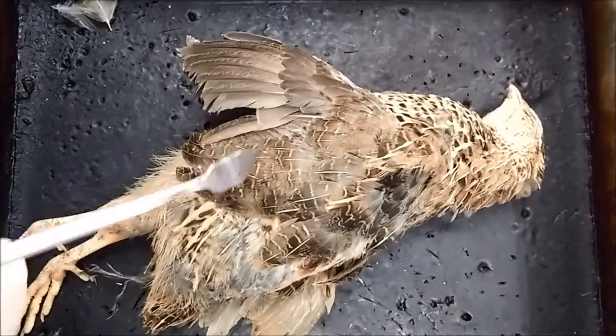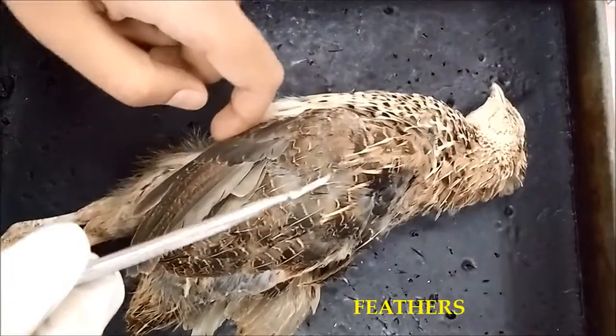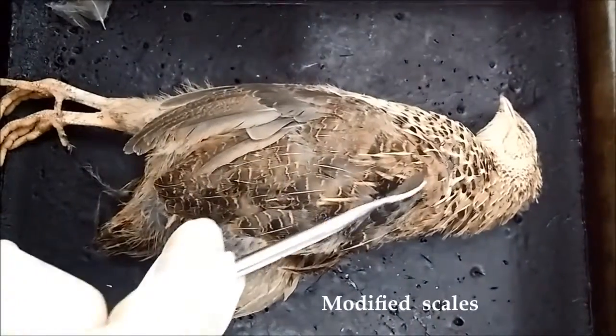Alright. Now we are going to observe the feathers of the birds. Basically, feathers are modified scales.